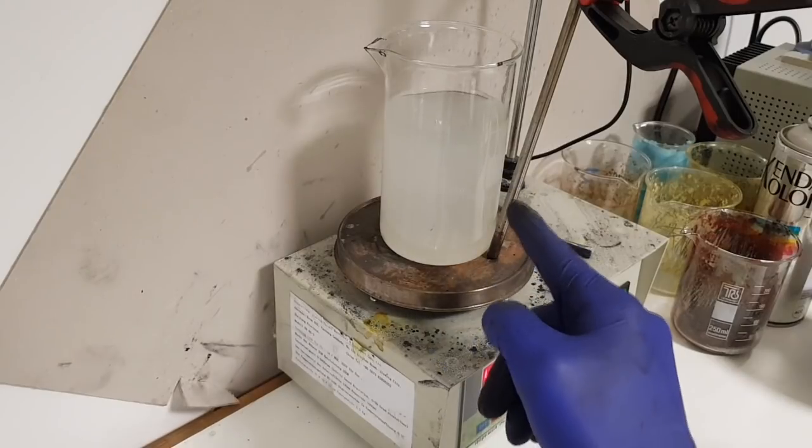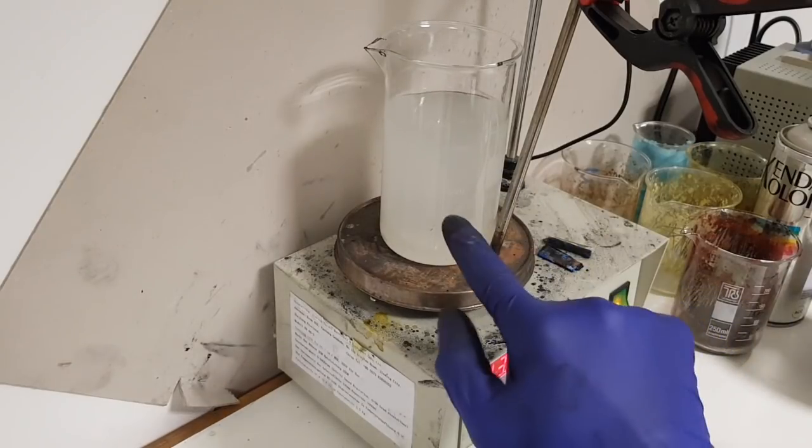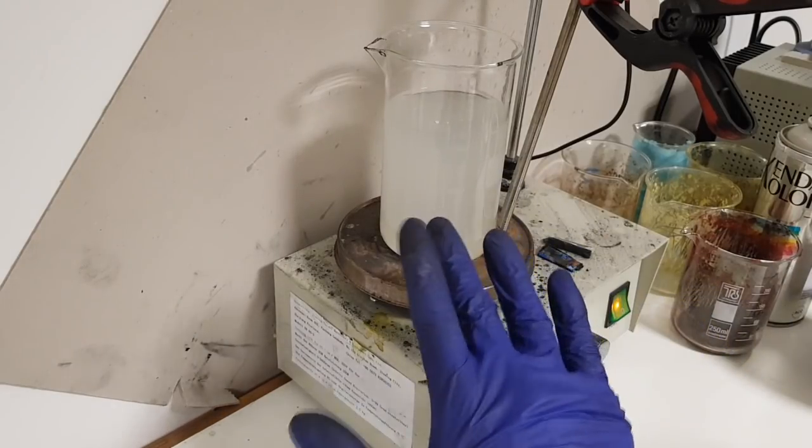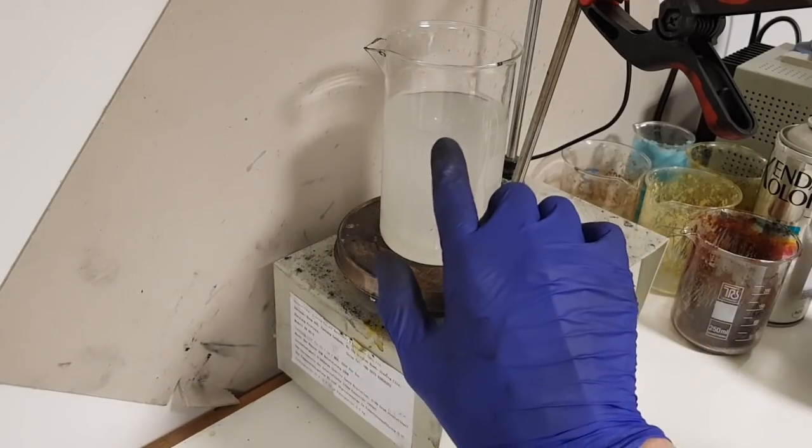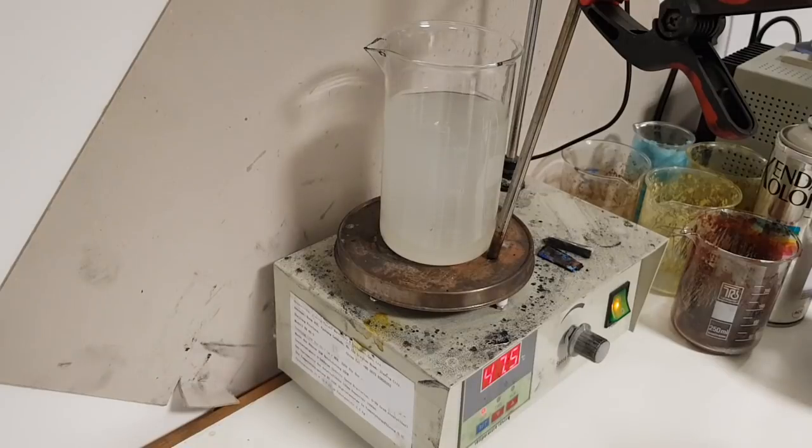And also, when everything is dissolved completely, I will leave it a little bit longer so that the water will evaporate a little bit and the solution is ready to use.